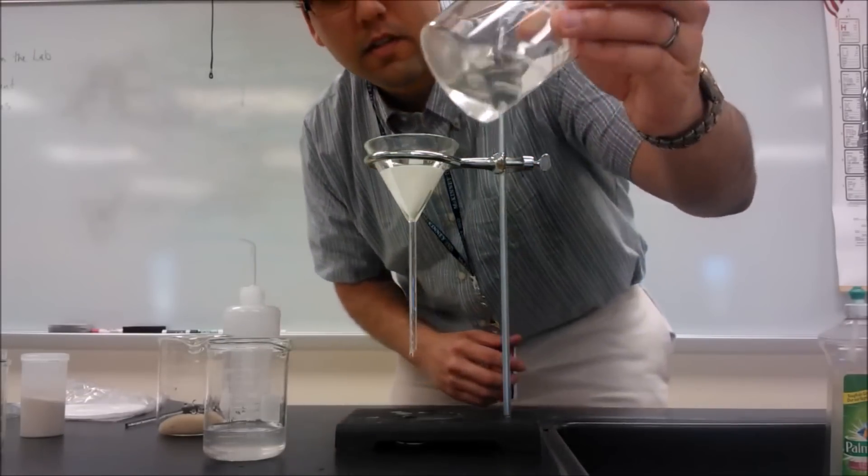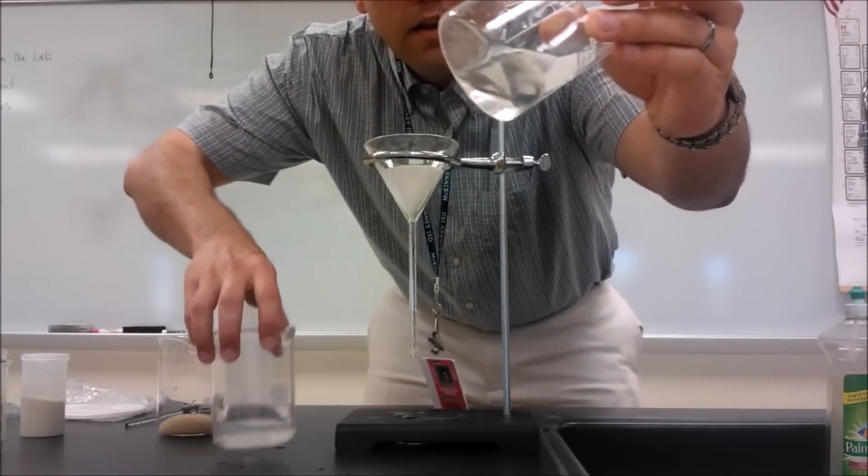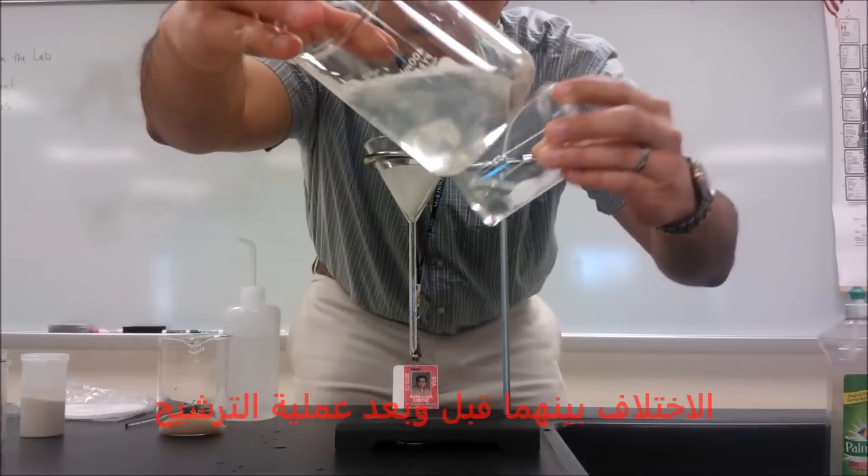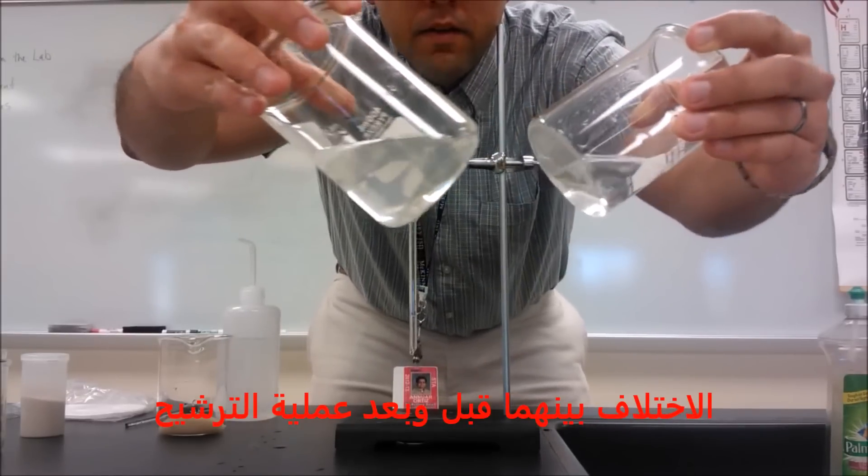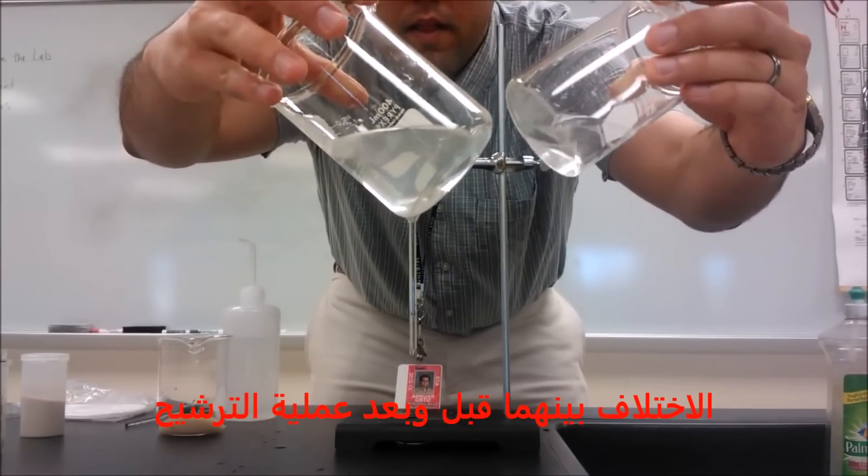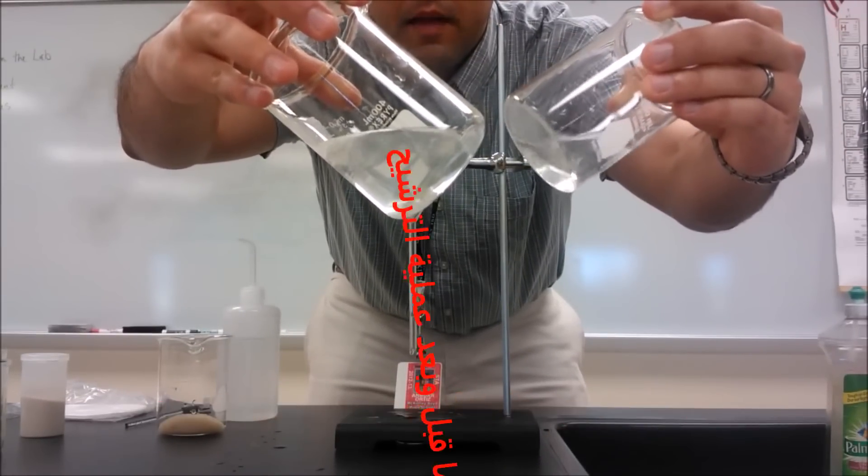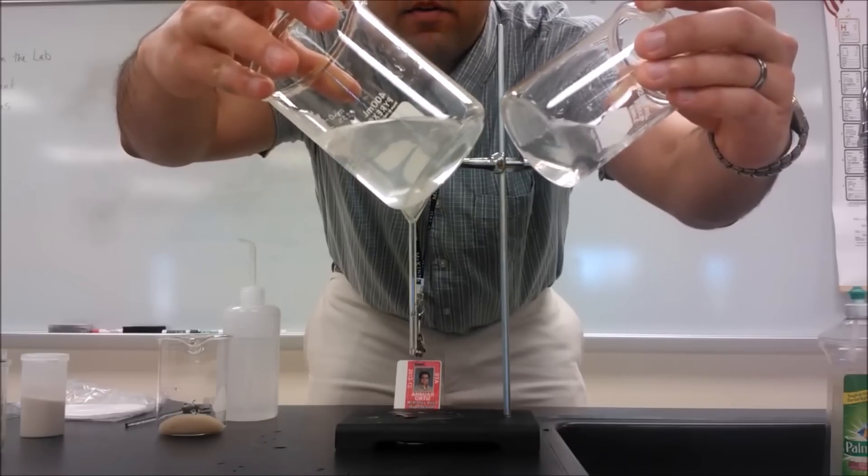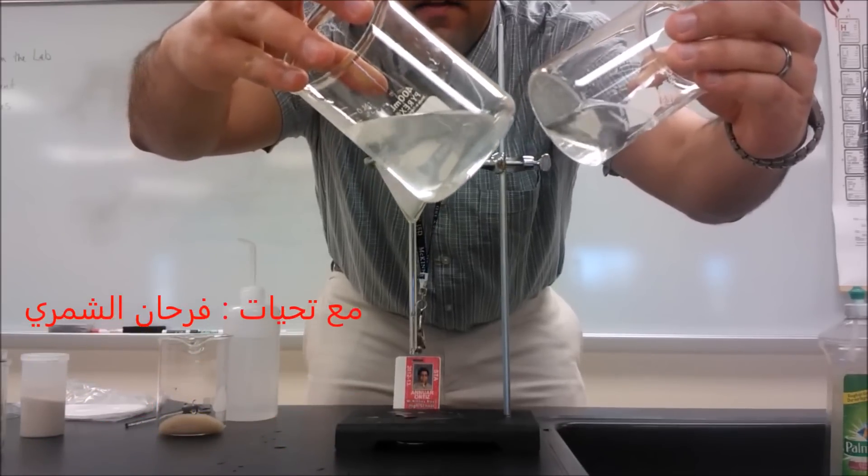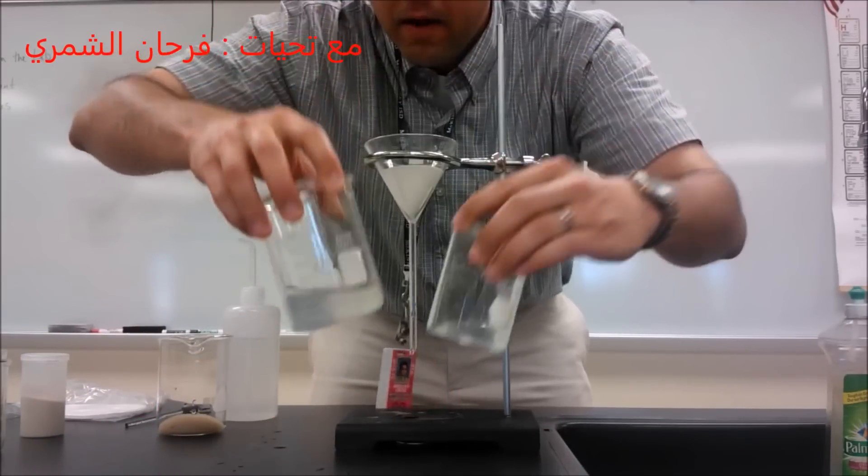...to show you the difference. You can see how this water is much more clear than this water. This one's kind of cloudy, this one's clear, and this is the water that has been filtered. The filter has been able to catch those smaller particles, those finer particles of sand that were still suspended in the water.